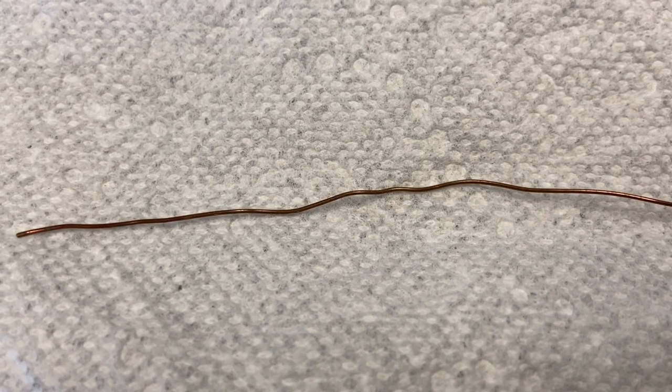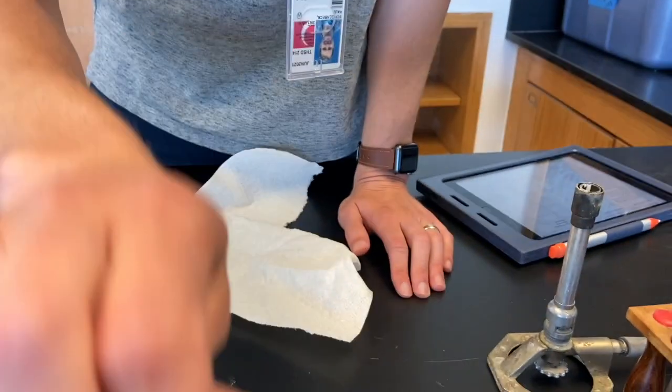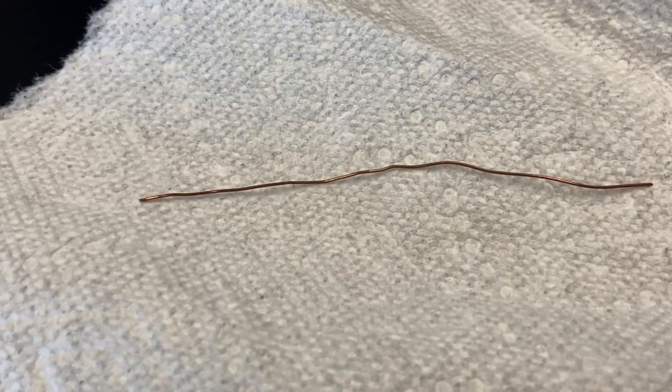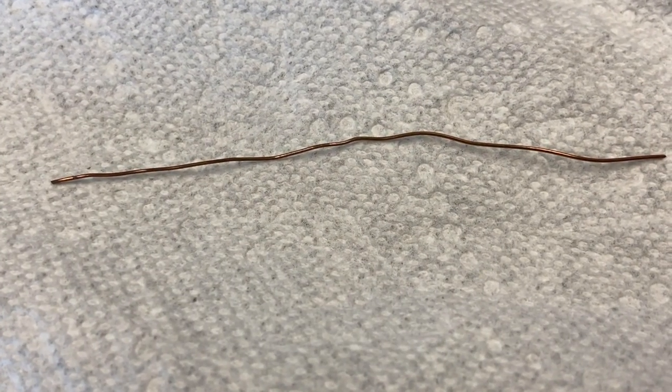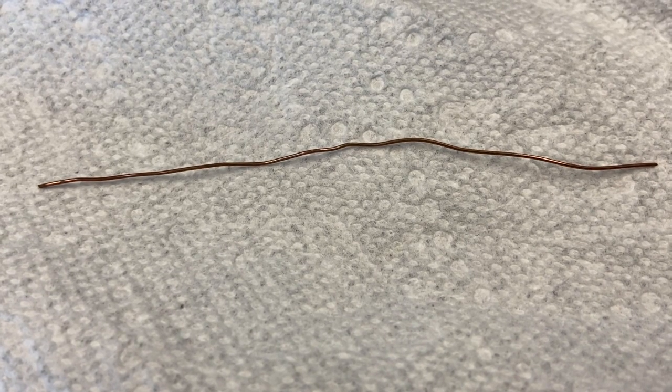Now, as you are looking at it, here's me just holding it for reference. You need to make your observations before. So things to think about for your observations would be what's its appearance, its color.